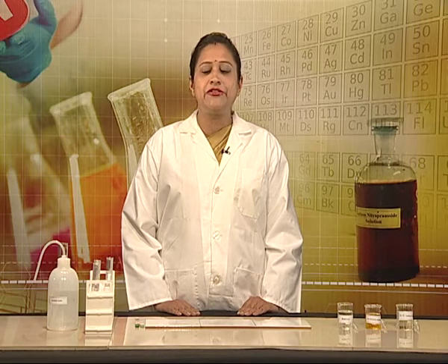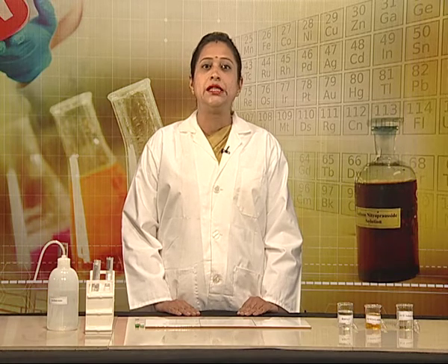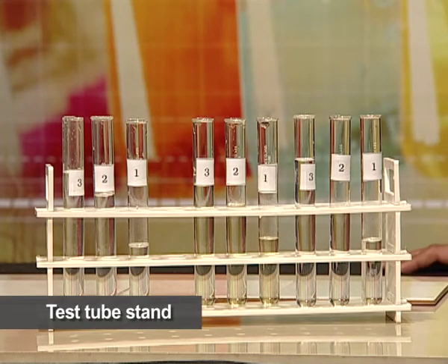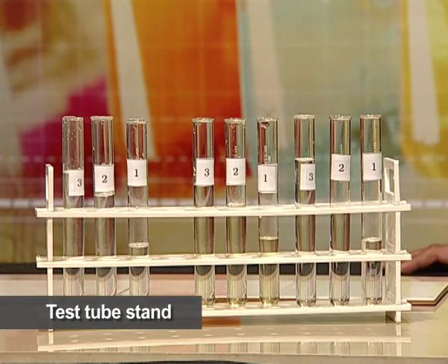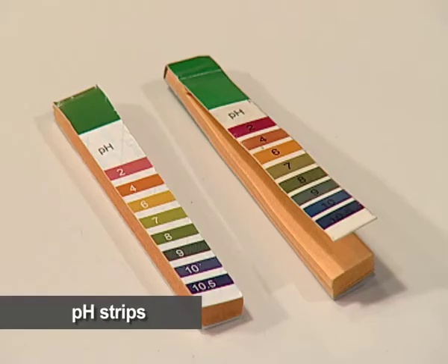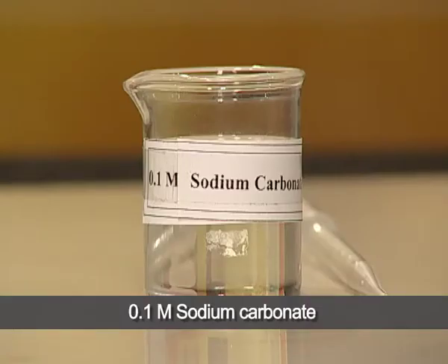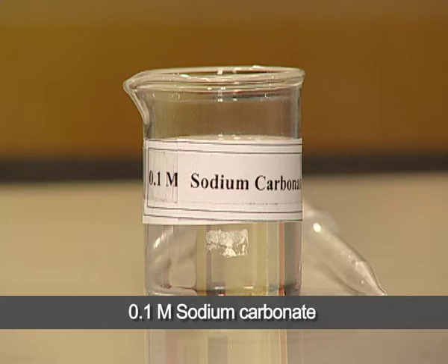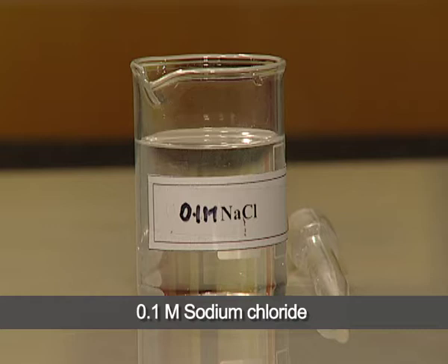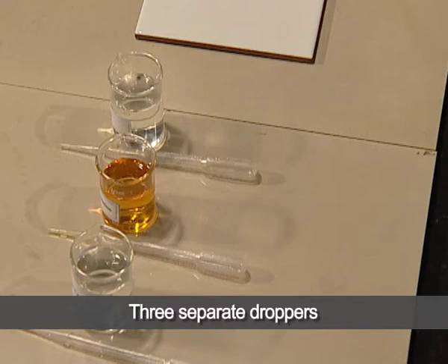We shall also study the effect of dilution on the pH of these solutions. The materials required are: a test tube stand, 9 test tubes, distilled water, a measuring cylinder, pH strips, glazed tiles, 0.1 molar sodium carbonate solution, 0.1 molar ferric chloride solution, 0.1 molar NaCl solution, and three separate droppers for each solution.